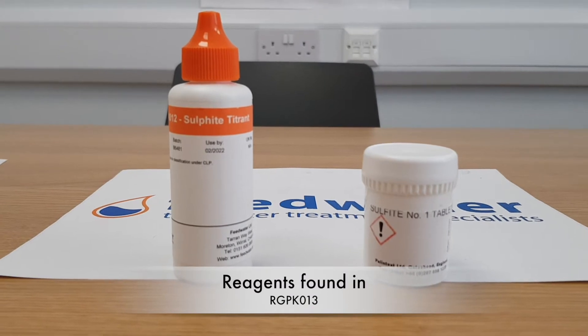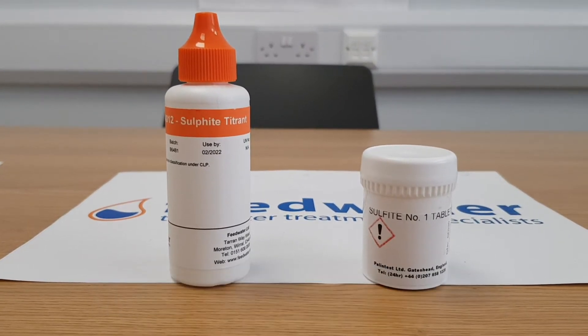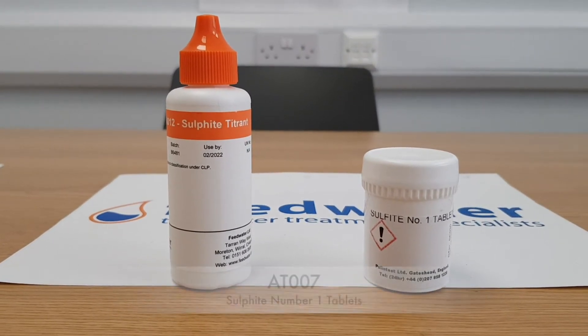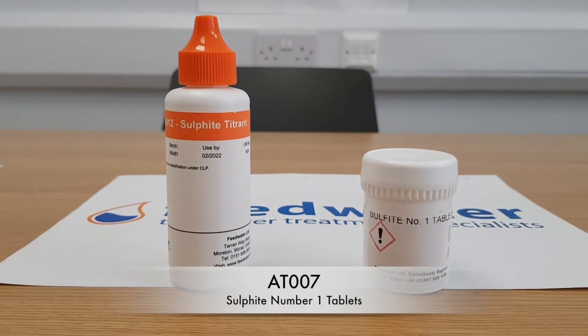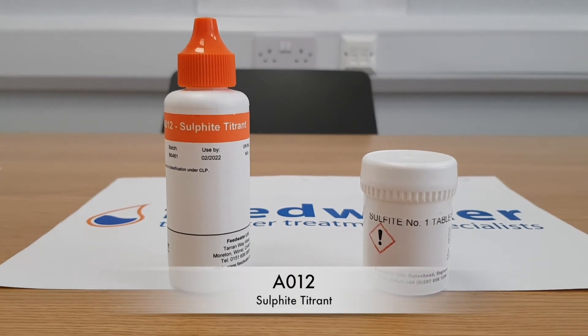For this test you will require the following reagents: sulfite number one tablets and sulfite titrant.